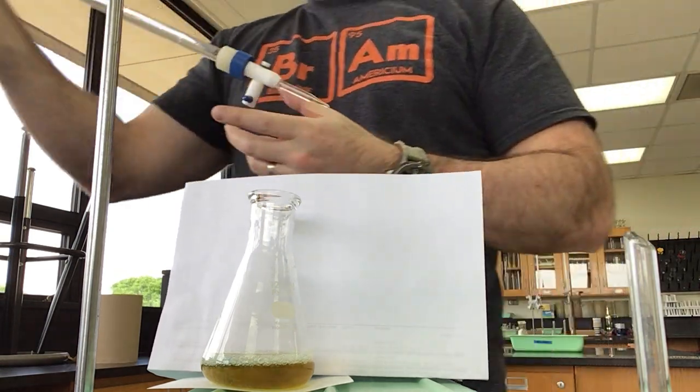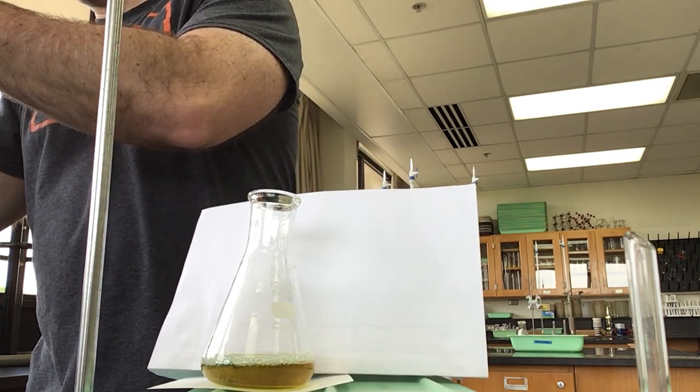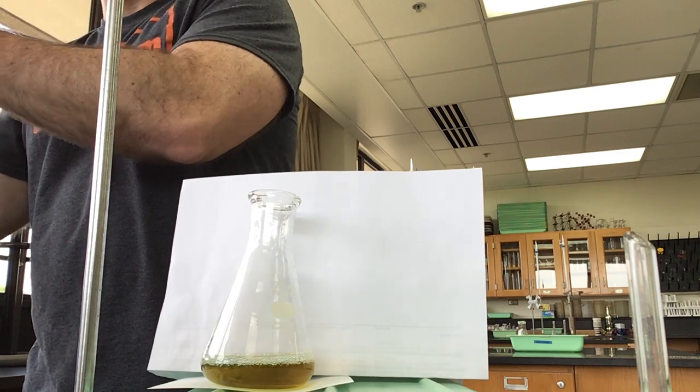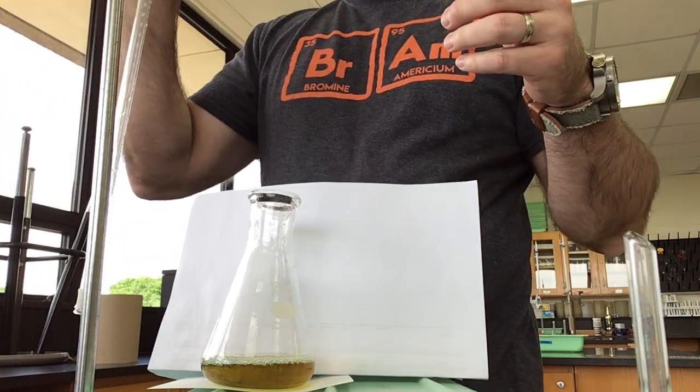I should note that the water we're using when we do this is the distilled or deionized water that we have in the room. We're never using tap water for that.